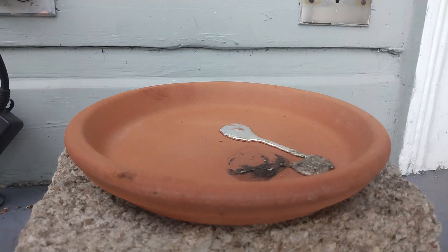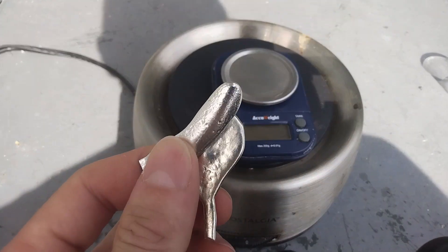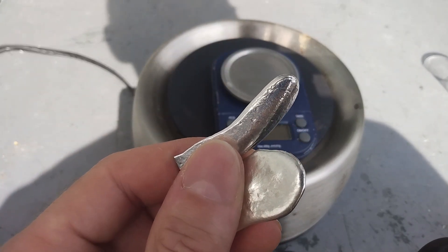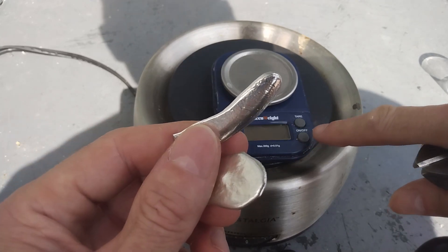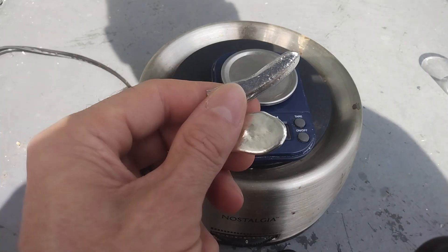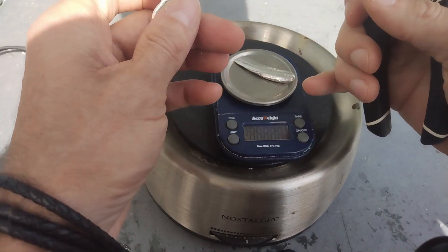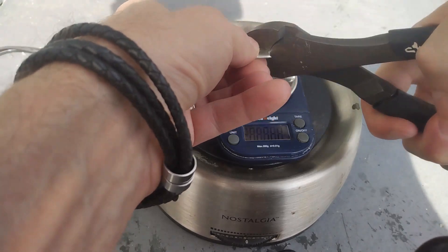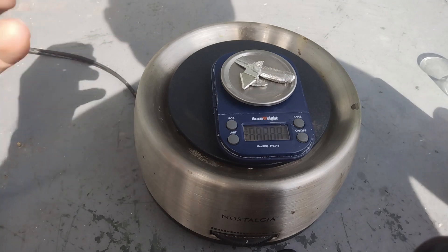All the oxide is here. Now I'm going to cut pieces out of this shiny part. I have some clean pieces of tin — that's an alloy of 95% tin and 5% antimony. I'm going to measure about 15 grams of it. I'll explain in a moment why I chose this value. Right now I have 11 grams, so let me add more — 12, 13... 15.1 grams.